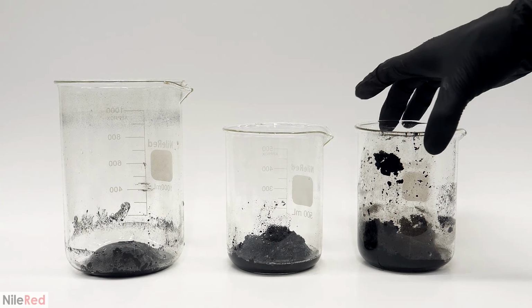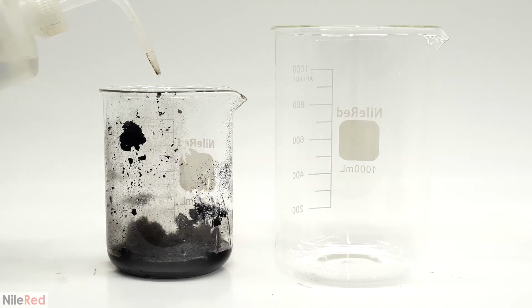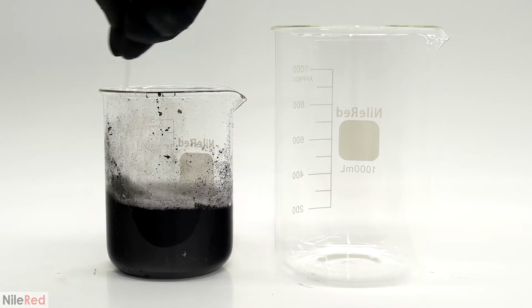Now, the next step was to wash the magnetite, but because the process is the same for all 3, I'm just going to show you what I did for one of them. In general though, the process was really simple. I basically just had to add distilled water and mix it around.